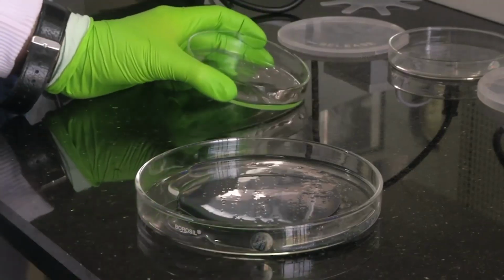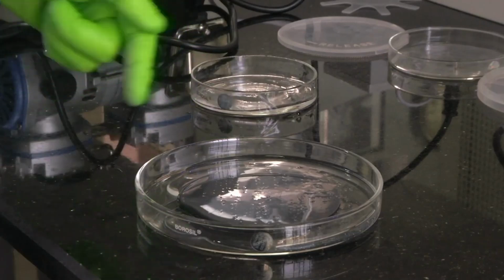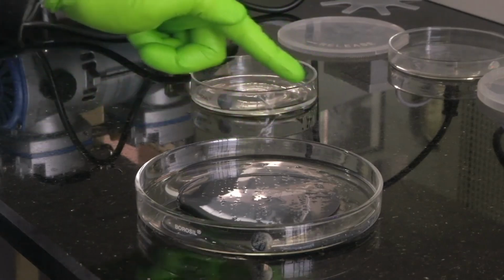So now we have fully poured. I cannot tilt it and show you because it will affect the surface profile of the PDMS. So now we have poured the PDMS on the mold. It is evenly distributed, but it has still formed a few air bubbles.